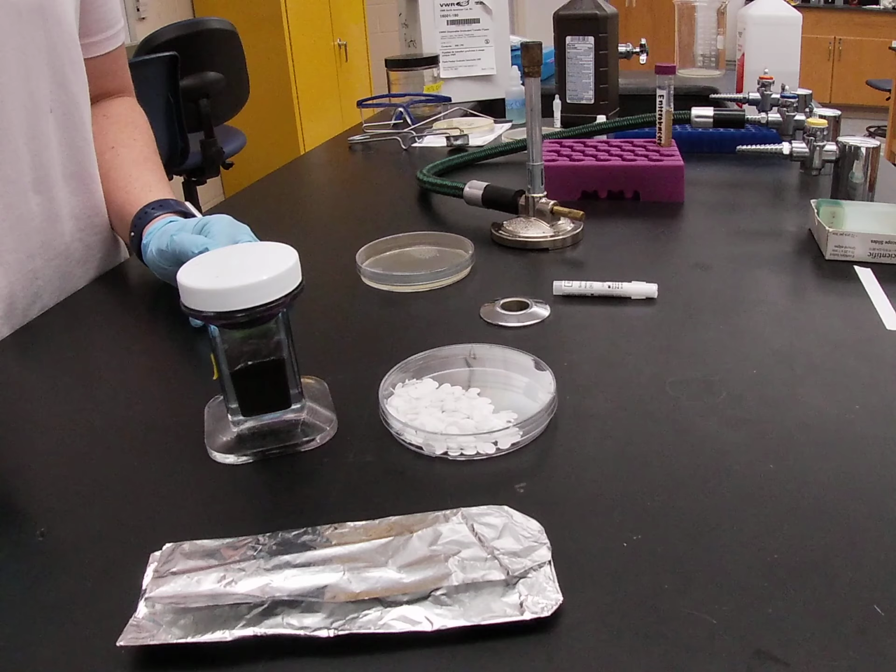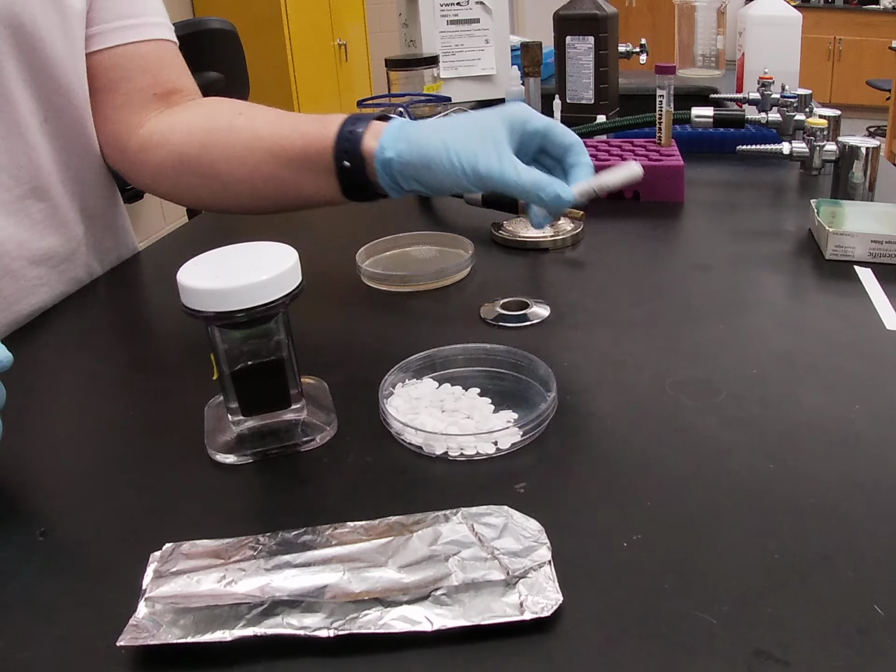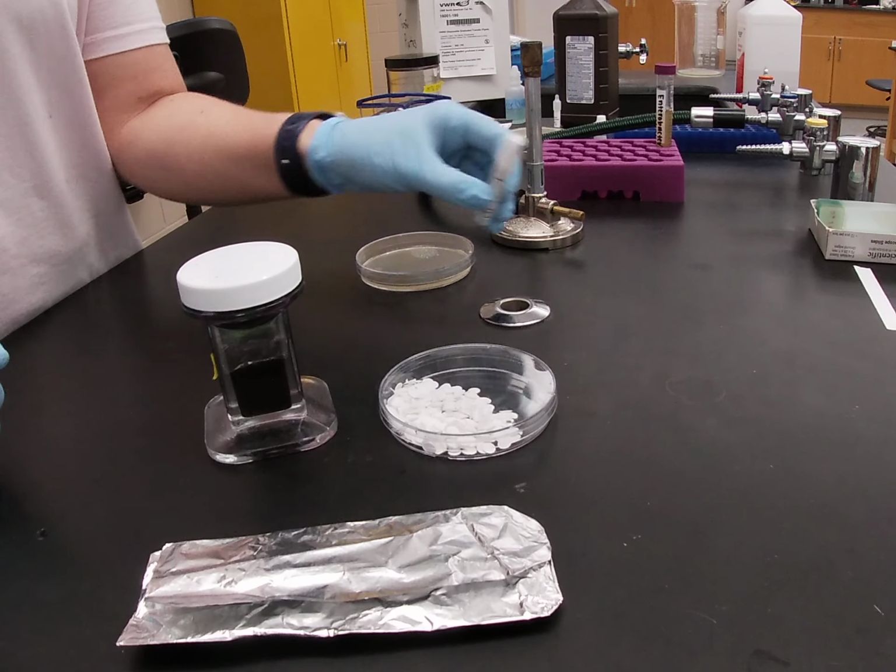So in this video, I'm going to demonstrate how to make your own susceptibility discs out of membrane filter paper and also how to use our prepared antibiotic discs.